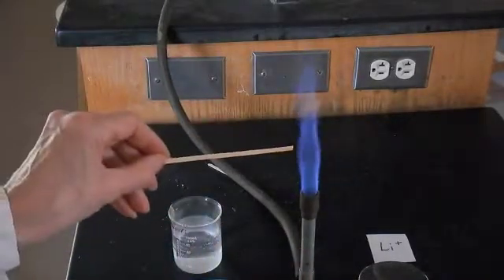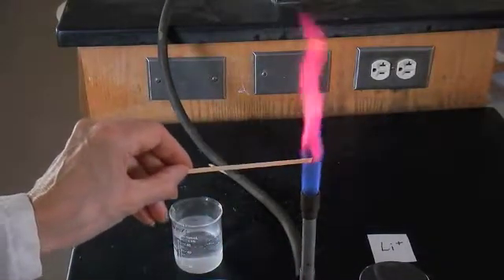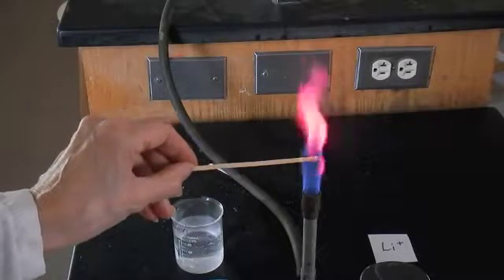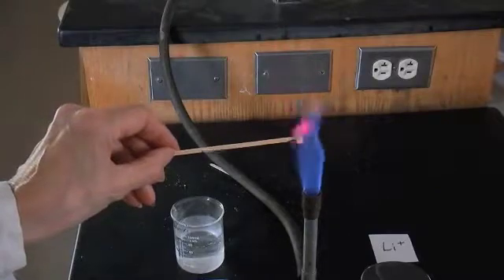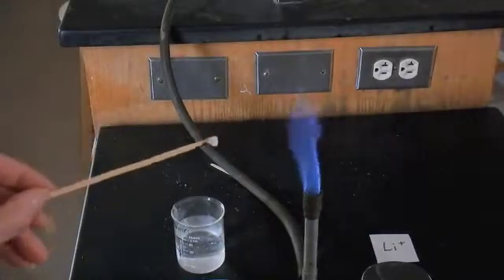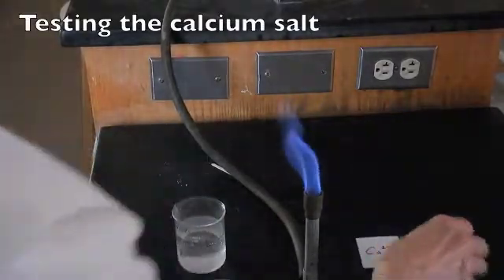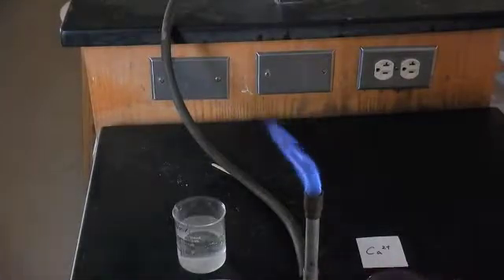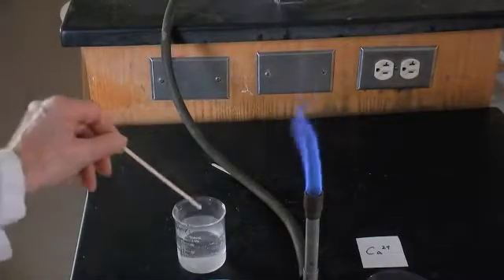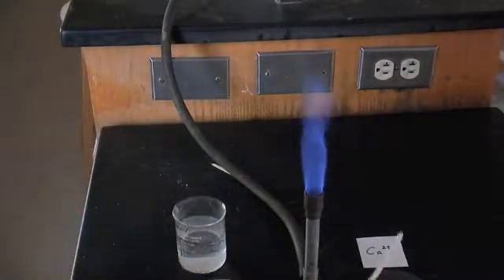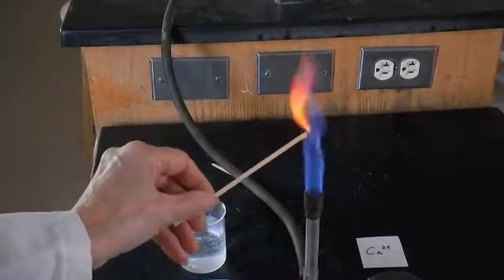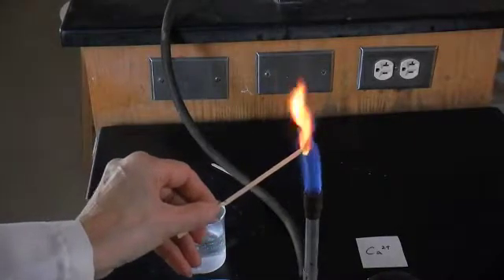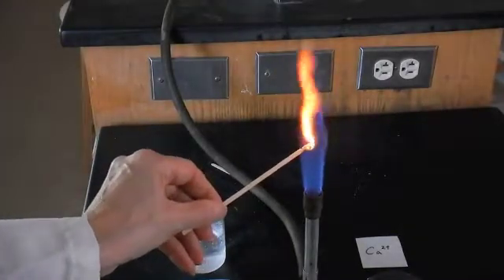Here we have lithium ion—quite a vibrant color. You're going to use your descriptive powers to write down the color. Going on to calcium, again a new taper each time so you don't cross-contaminate. Different from the lithium and very different from the copper that we started with.